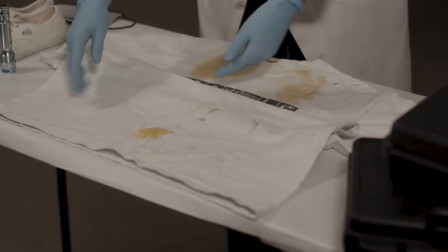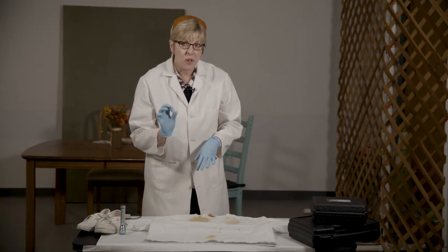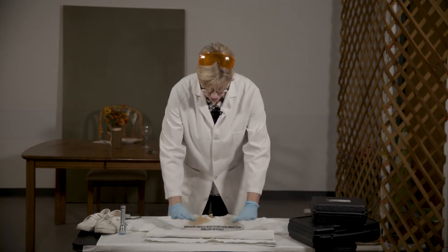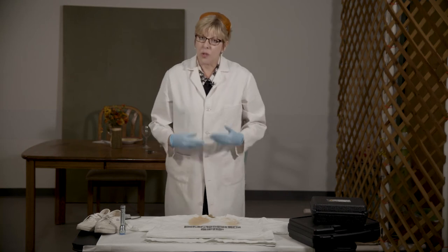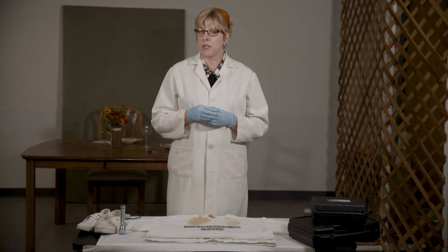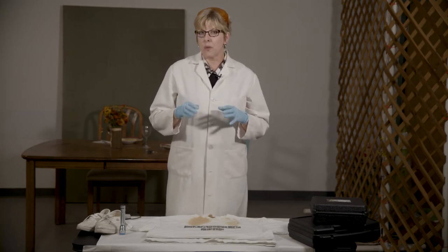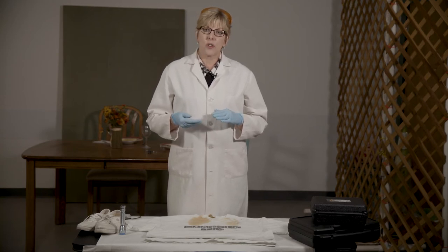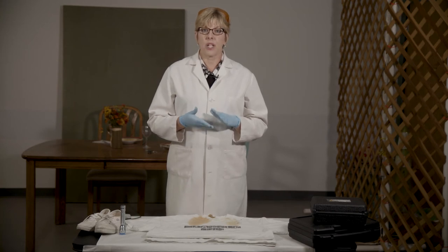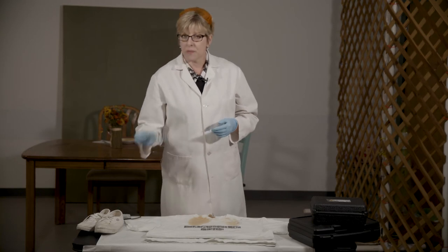There's a lot of stuff on this shirt, but there's also more than meets the eye. Using an alternate light source can help you visualize materials that will fluoresce under that particular wavelength of light. In this case, what we're looking for would be biological materials. There are certain biological materials, such as saliva and urine, which will fluoresce underneath blue light.